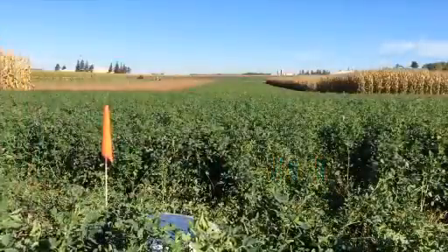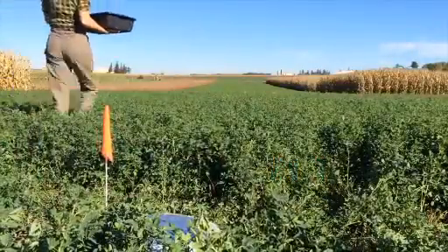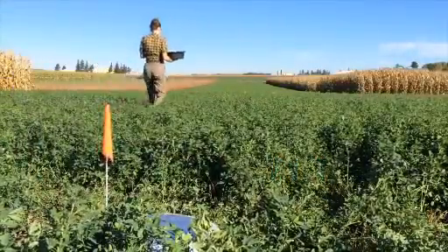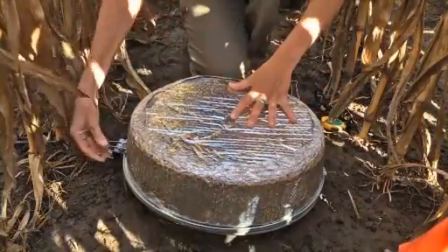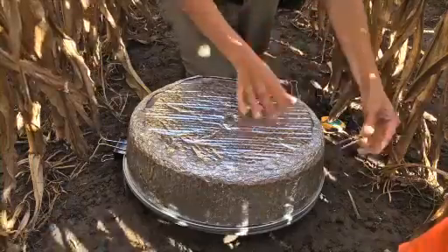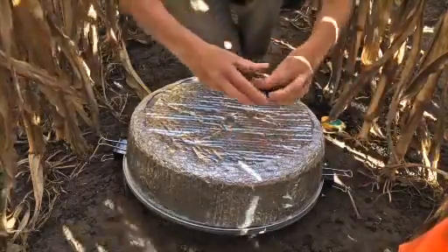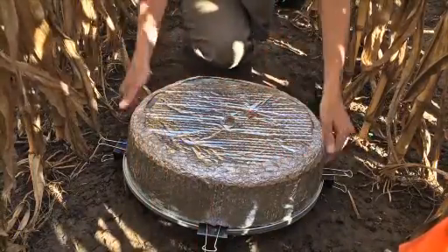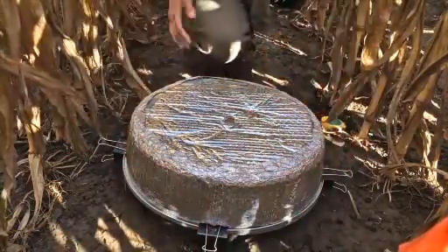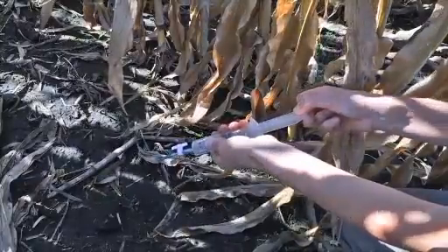After completing collection of one sample, proceed to the next chamber site and repeat this process, sealing the lid on the correct, predetermined time point. When attaching lids, take care to ensure that a good seal is achieved, with no gaps or debris allowing leakage. Continue until all chambers have been sealed and T0 samples have been collected.